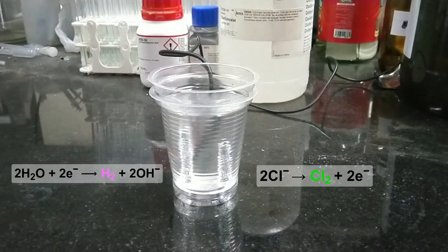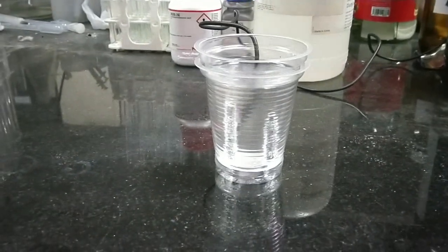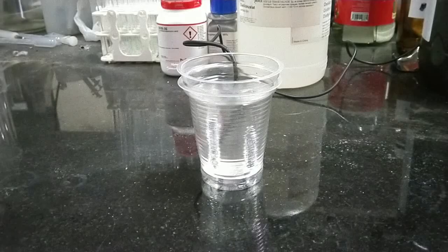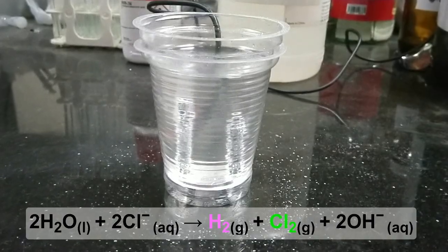But here you need to be warned that the chlorine is a toxic gas and you should do this in an open place. You see the overall equation of the cell reactions.